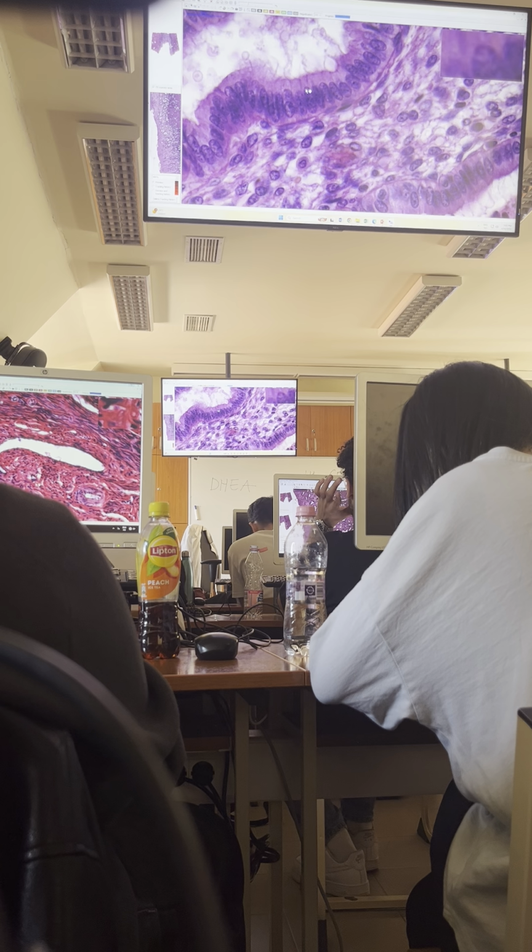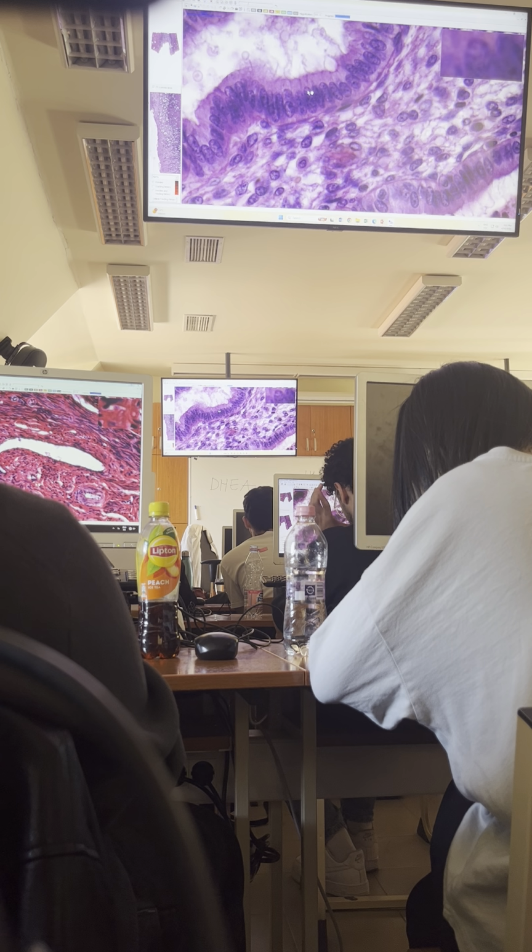And also, if you magnify, now you can see these secretory cells, which look a bit different now, because remember, in the first half of the cycle, the nucleus was centrally located inside the cell. But now you can see that the apical portion is bigger than this basal portion, because here in the apical part, secretory product is already accumulating, which pushes the nucleus down.